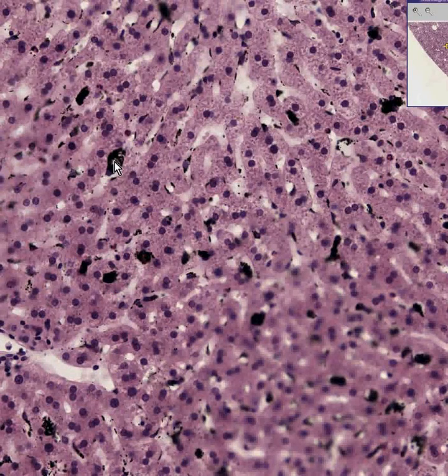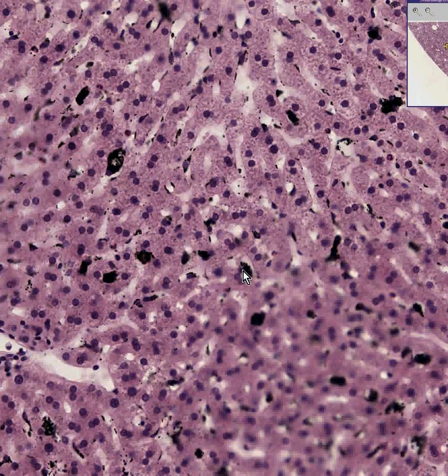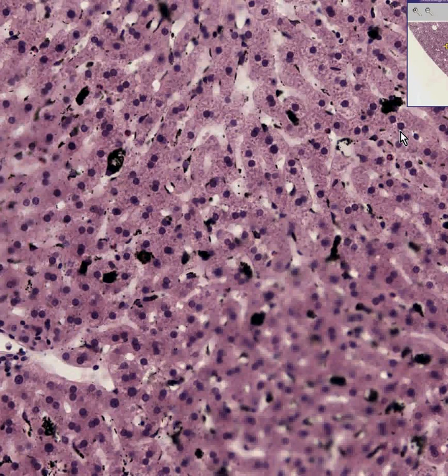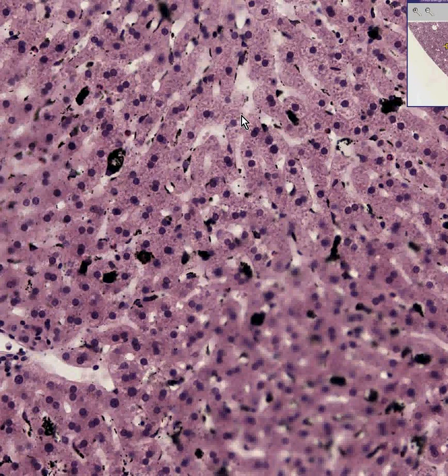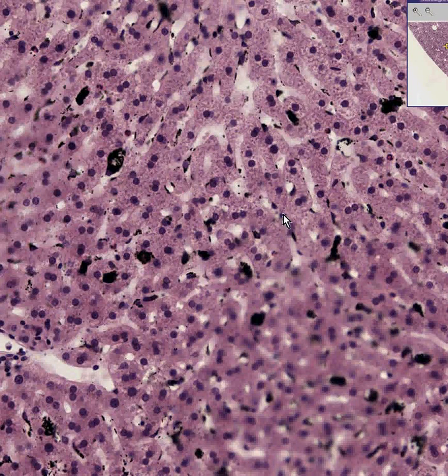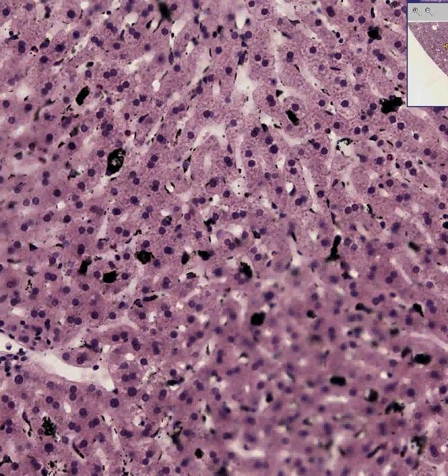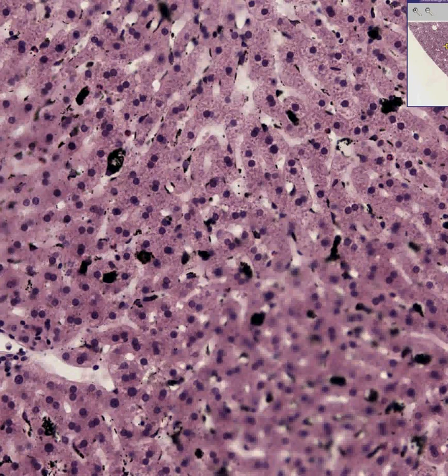So this is a great way of differentiating Kupffer cells — here, here, and here — from the rest of these cells on the inside, which are hepatocytes. And I thank you very much.